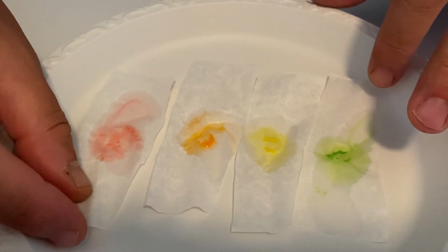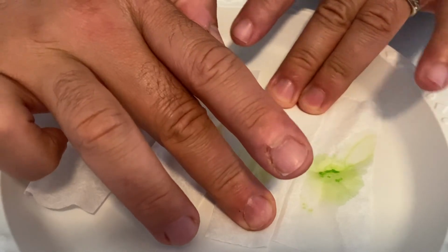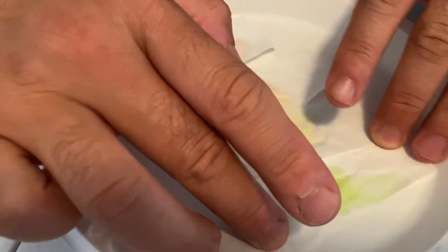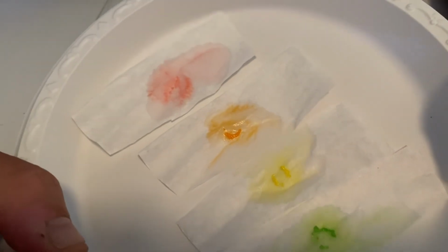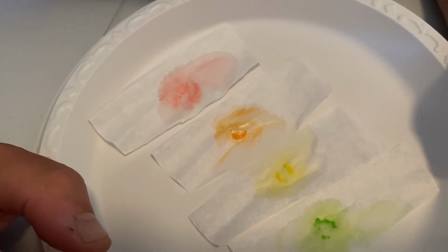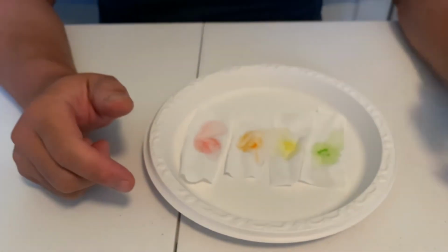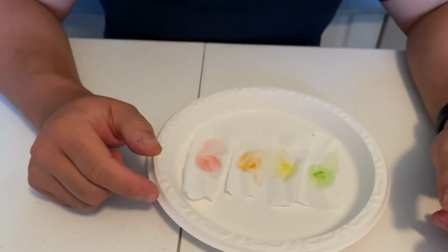So, as you can see, it's going to start to separate. We can see some different colors, but it definitely separated. I wonder what it would have looked like if we would have done a purple. It's always a good idea to go back and try. We're going to wrap up our lesson here with going back to our nature's colors and wrapping up that activity.